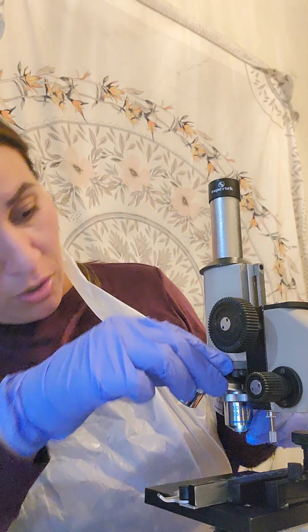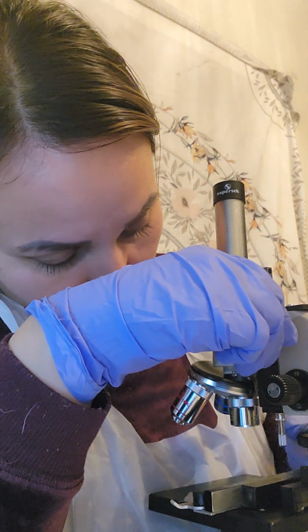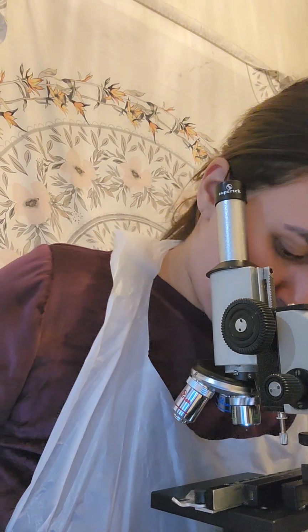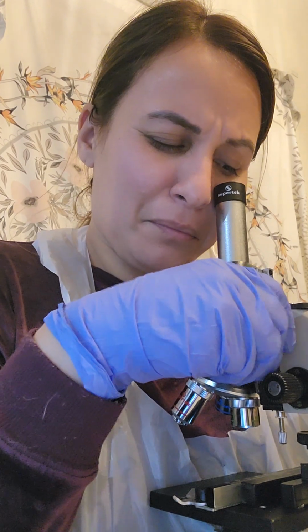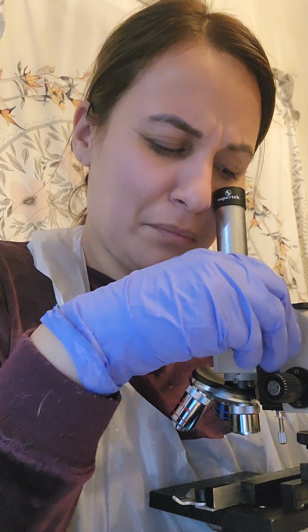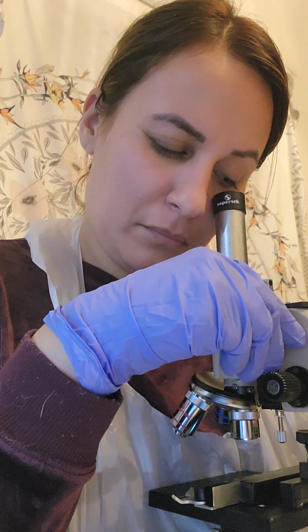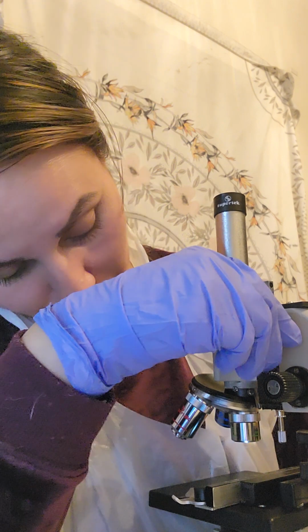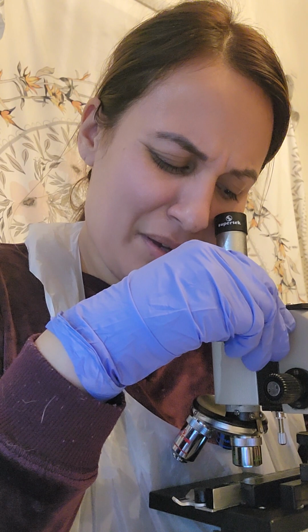And I'm going to start on the lowest setting, making sure I have everything in, going under the light.